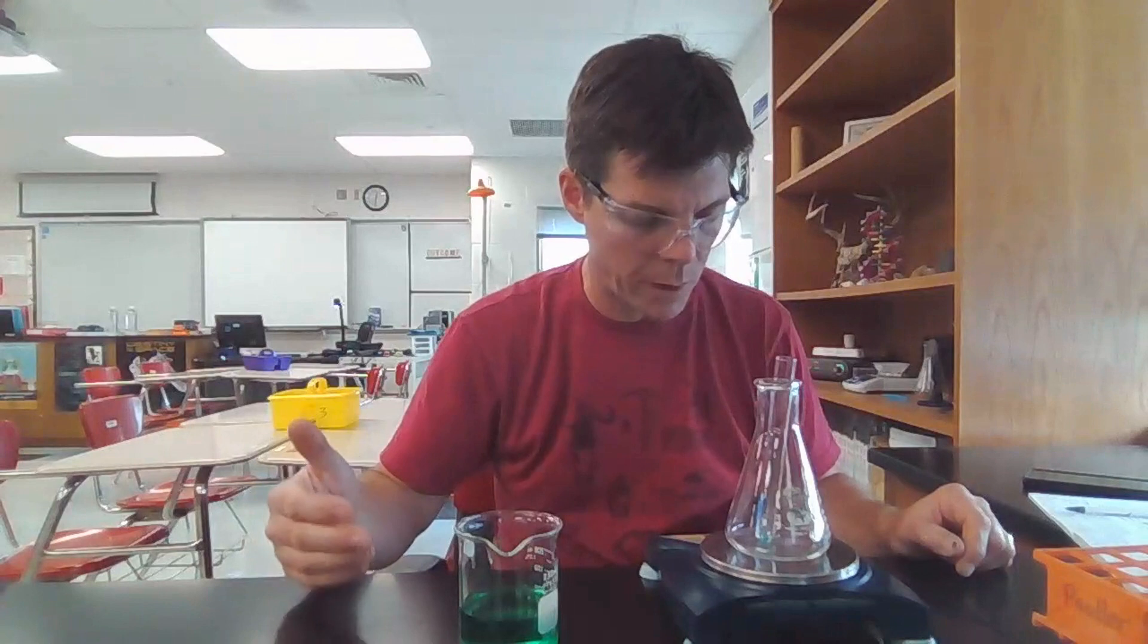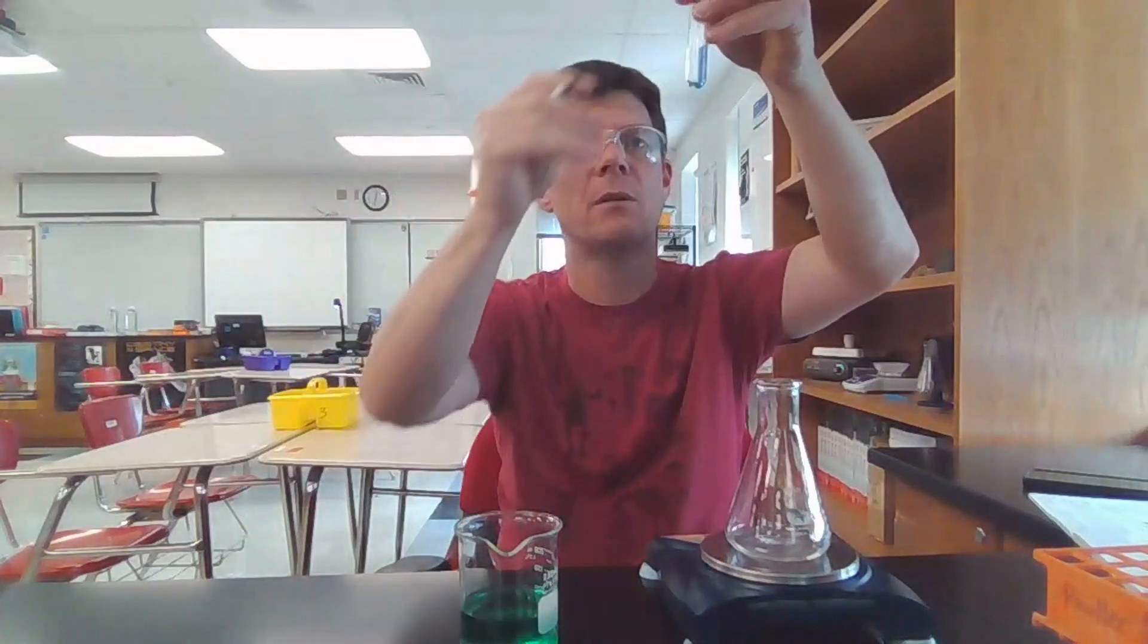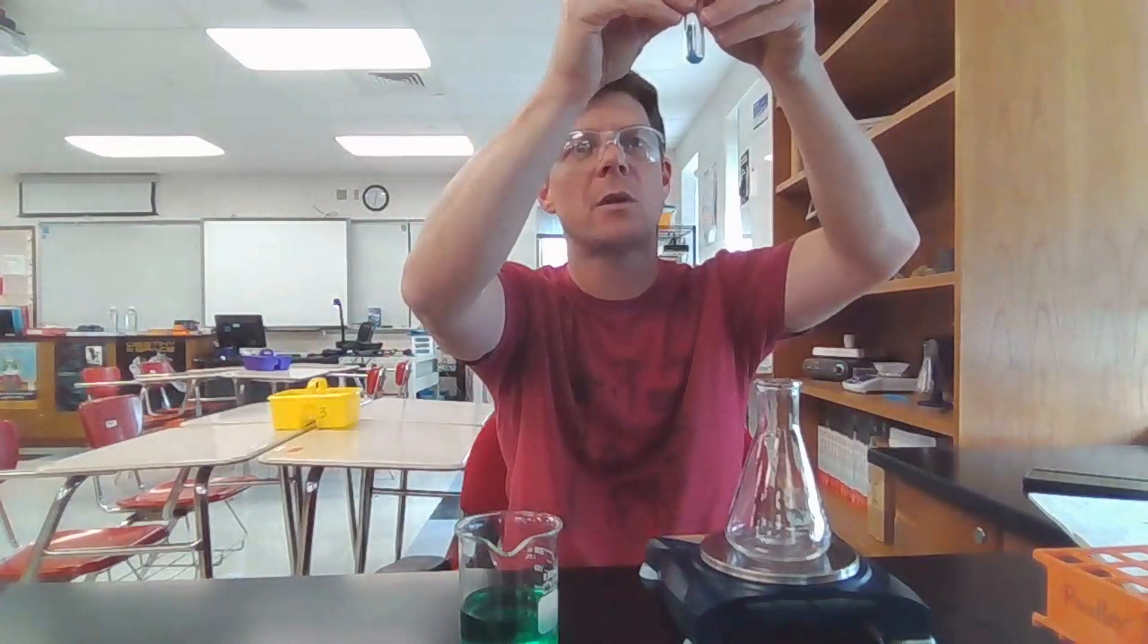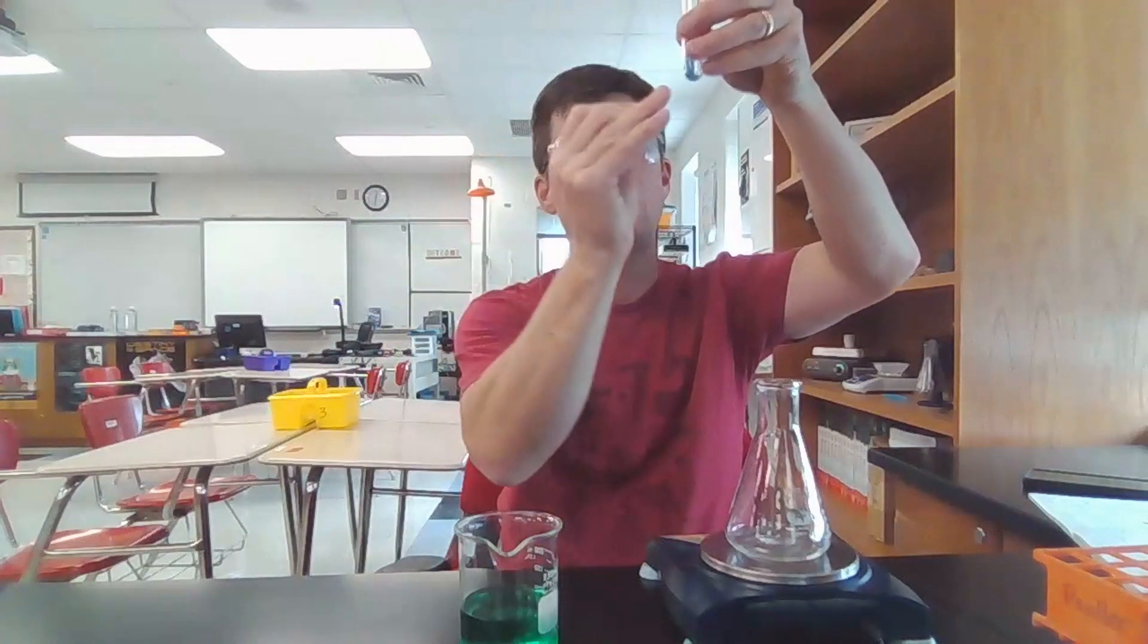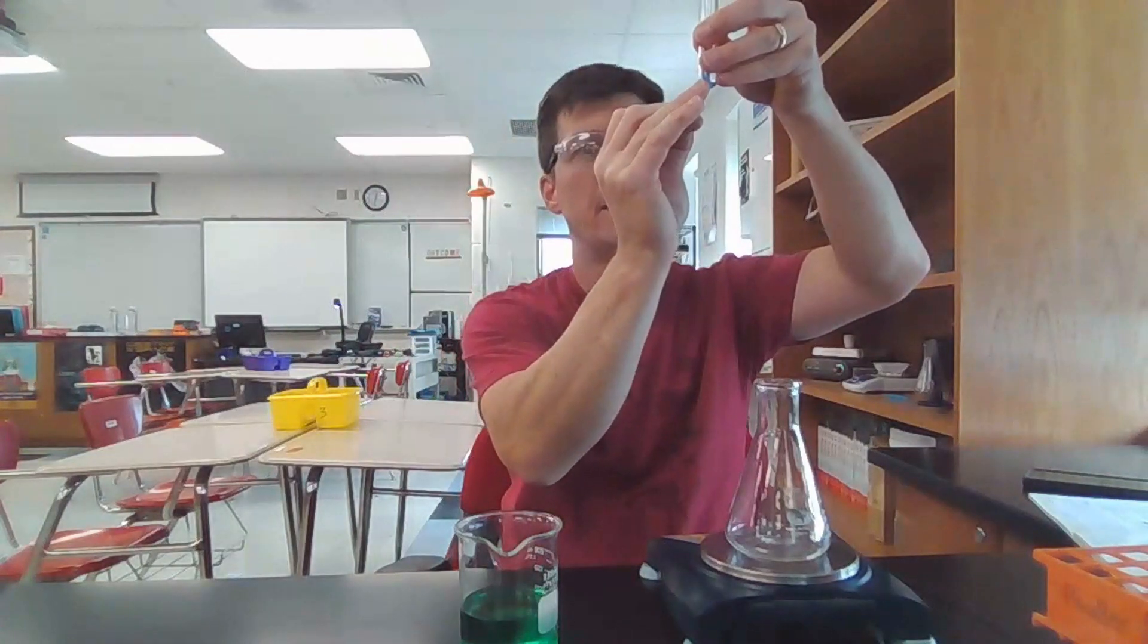With each addition of liquid, I'm going to be marking on my test tube the bottom of the meniscus. So I'm going to be marking the bottom of the curve of the liquid. I can actually see those two parts of the curve that I can visualize. So I want to mark the bottom one with a line on my tape.